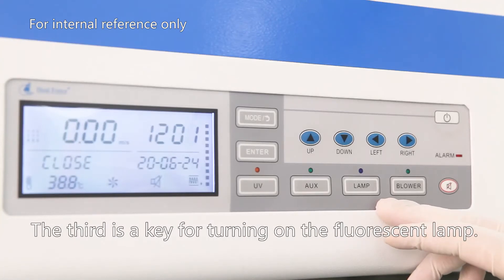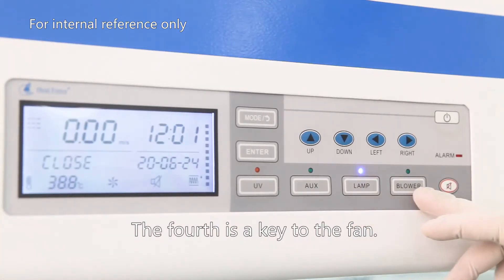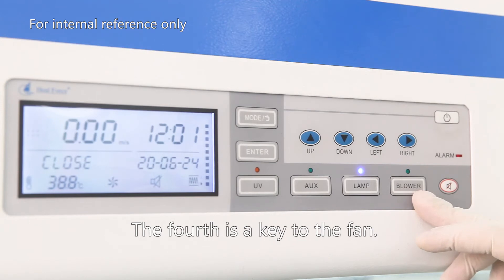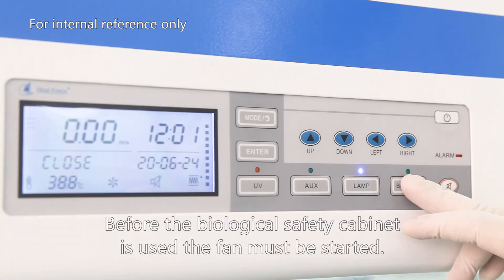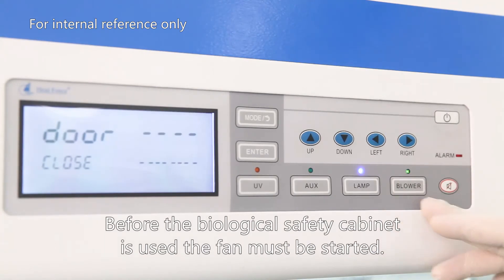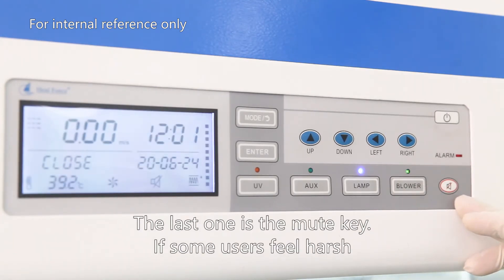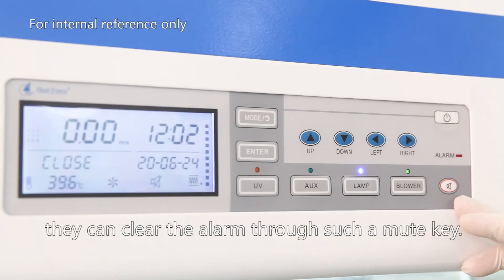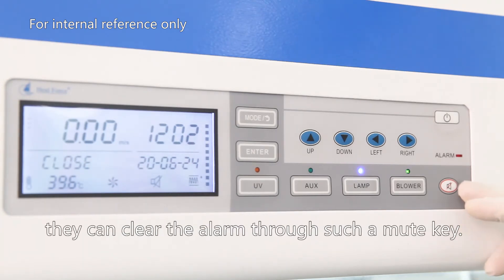The third function key is for turning on the fluorescent lamp. The fourth is the key for the fan. Before the biosafety cabinet is used, the fan must be started. The last one is the mute key. If some users find the alarm harsh, they can clear the alarm through the mute key.